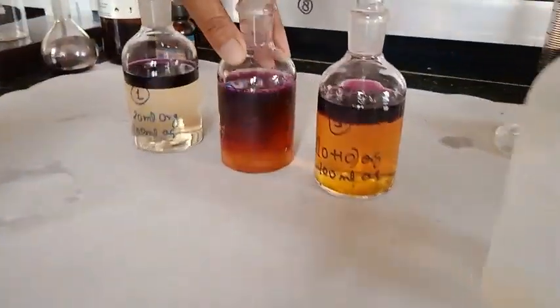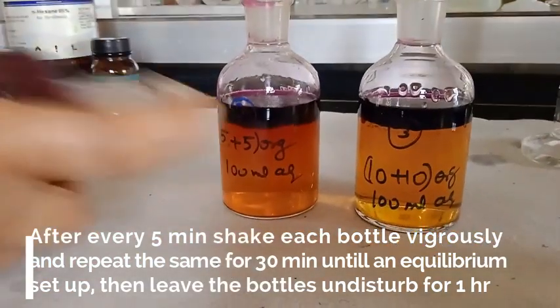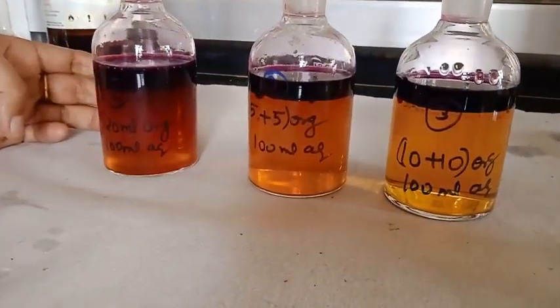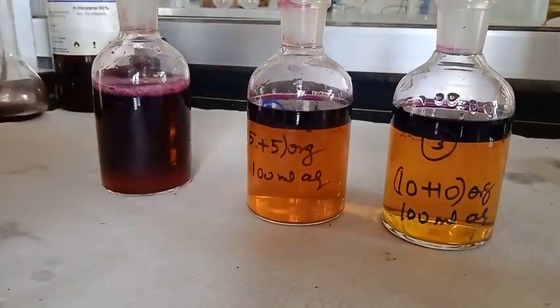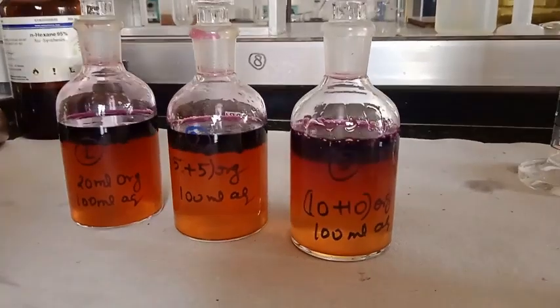So here you can see the color in the aqueous layer, and it is clearly seen that as the concentration increases, the color increases. So in the first set we are having dark color as compared to second and third.